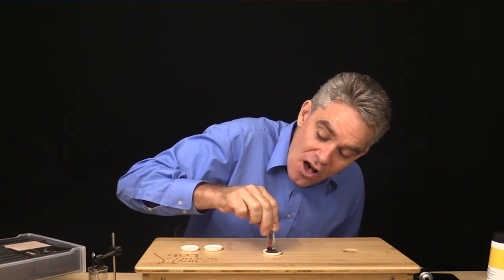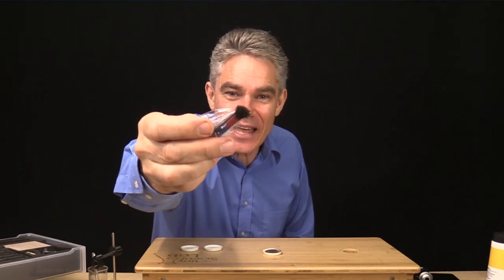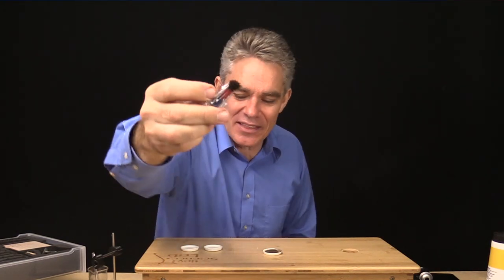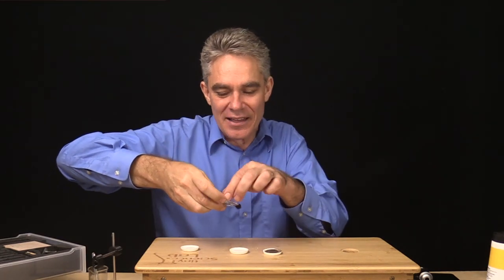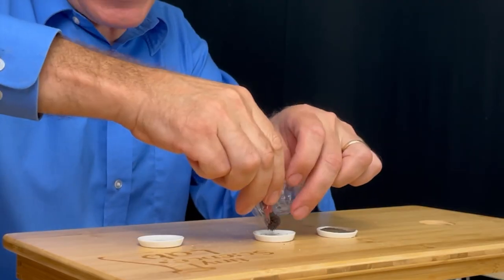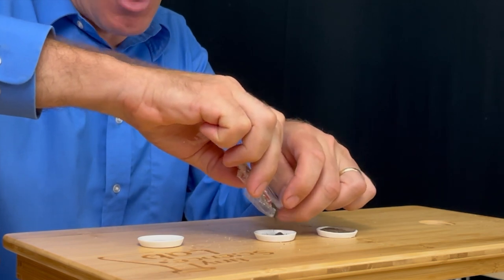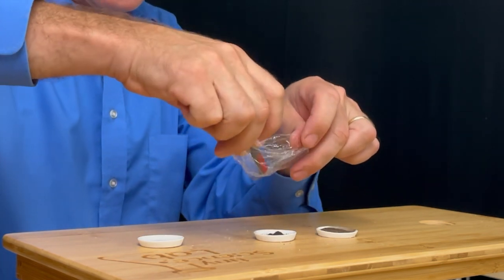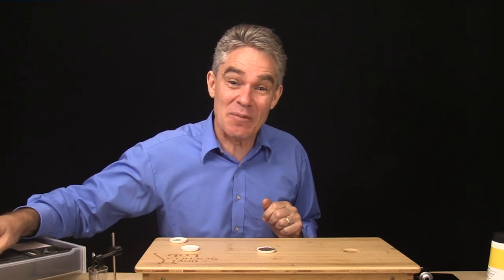That's good practice when you're using a magnet with very fine things. I'll put the cling wrap over the magnet and now I'll drag the magnet — wow, look at the iron filings on the end of that magnet! I'll just clean that off. I'll pull the magnet out of the cling wrap and then the iron filings drop off. Now I've got some sand and some salt — how do I separate those two?